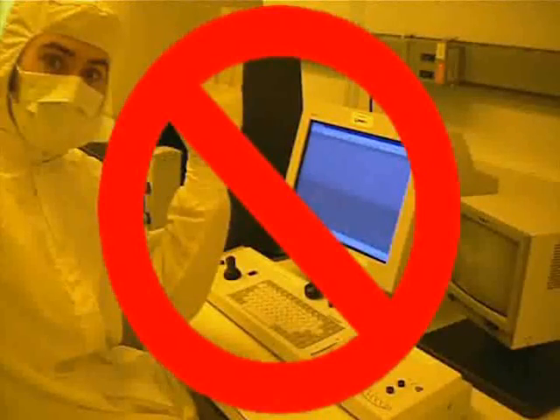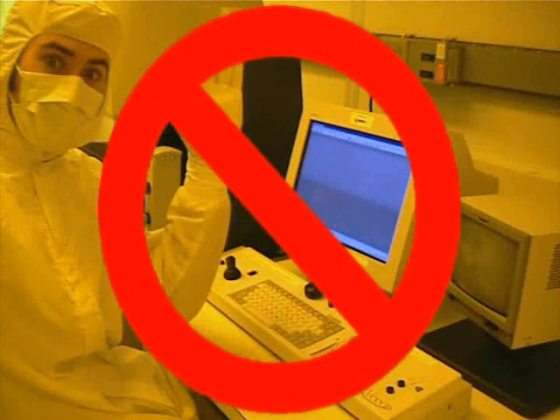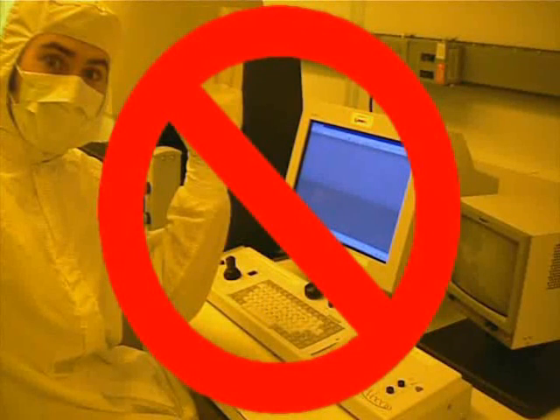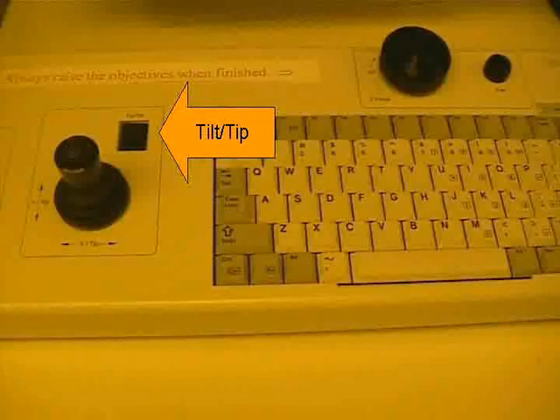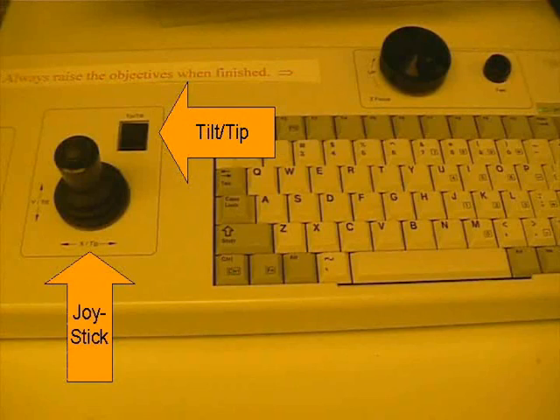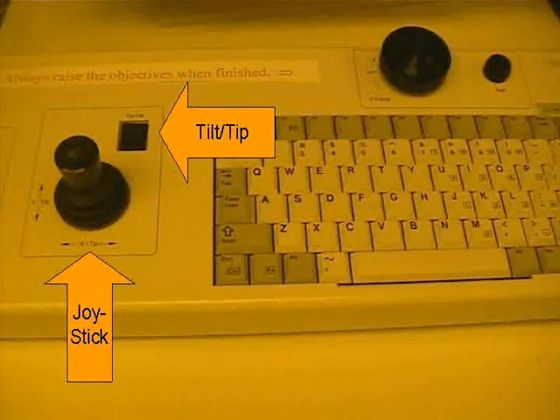Do not crash the objective lens into the sample. We can tilt the objectives by pressing the tilt button and moving the joystick. This is how we can rotate the fringes or adjust the fringe spacing.